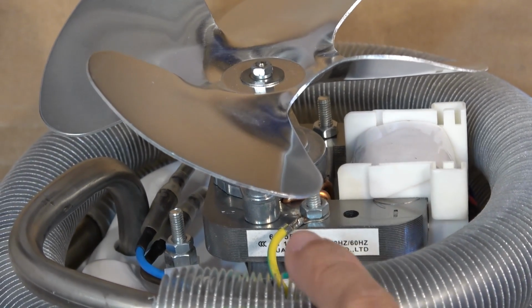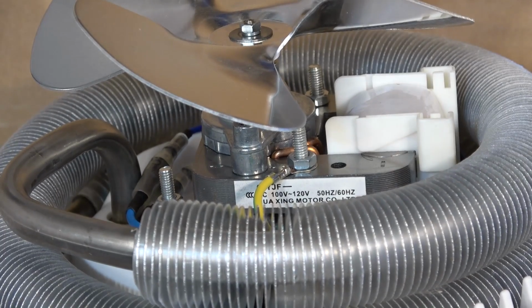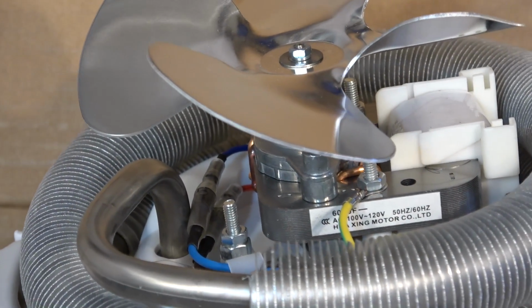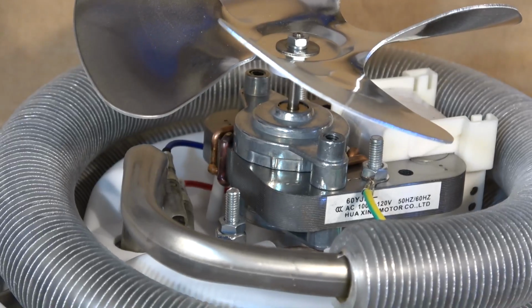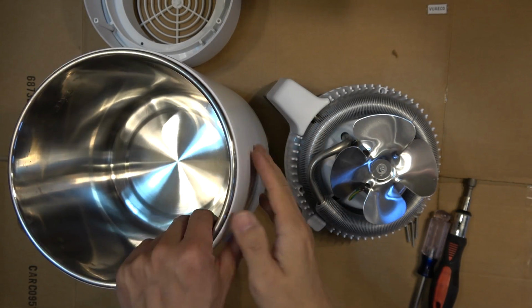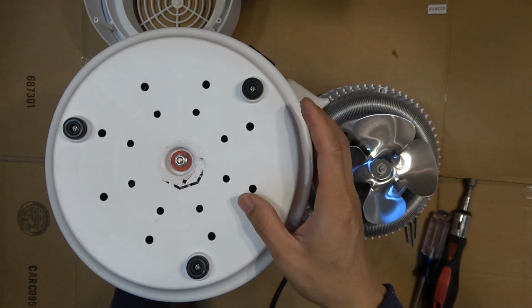It is a 100 to 120 volt, 50 hertz AC fan. It looks pretty similar to the fan in a microwave. So there you have it. What's inside a 1 gallon water distiller? This thing is built so simple. It's built like a tank.